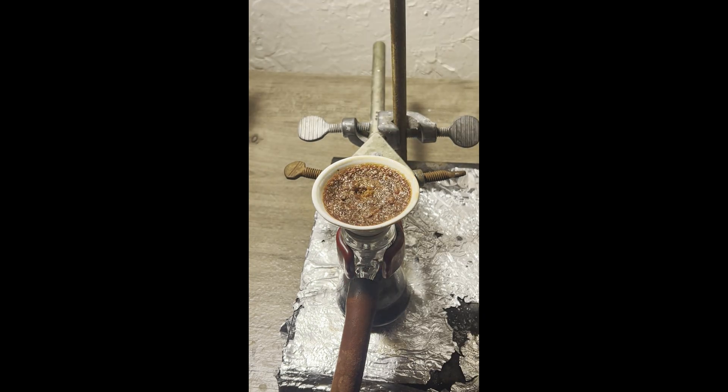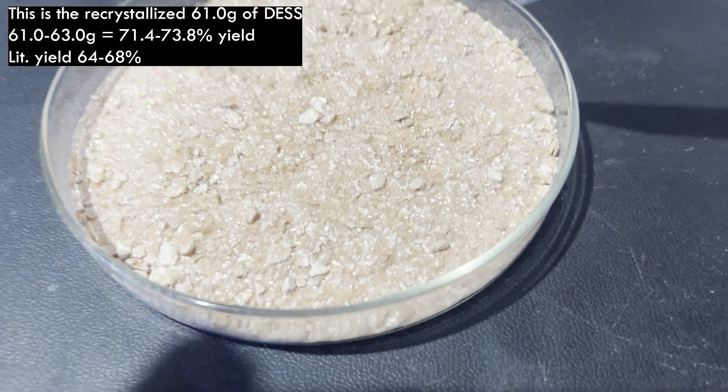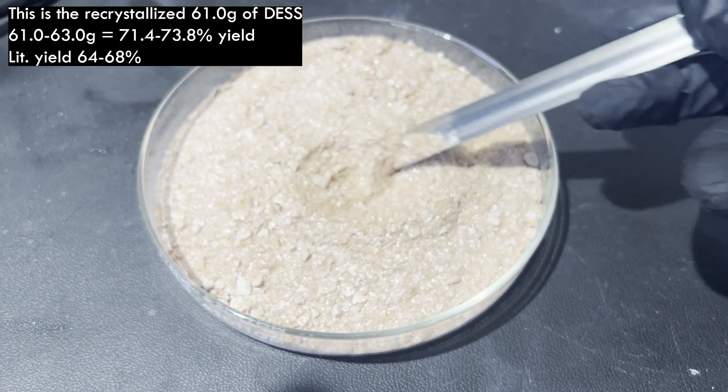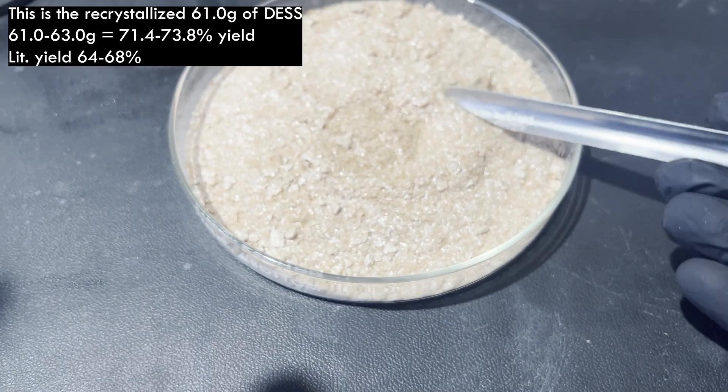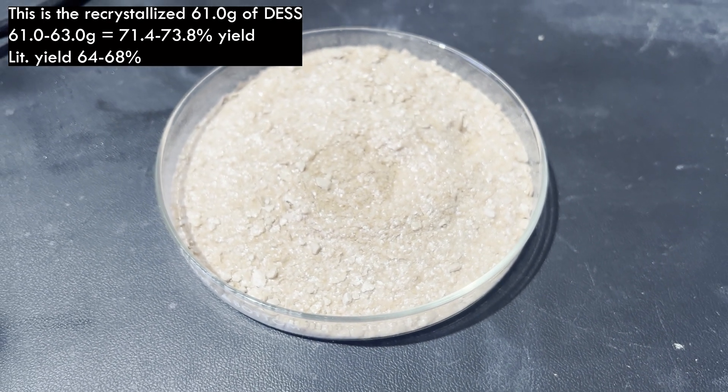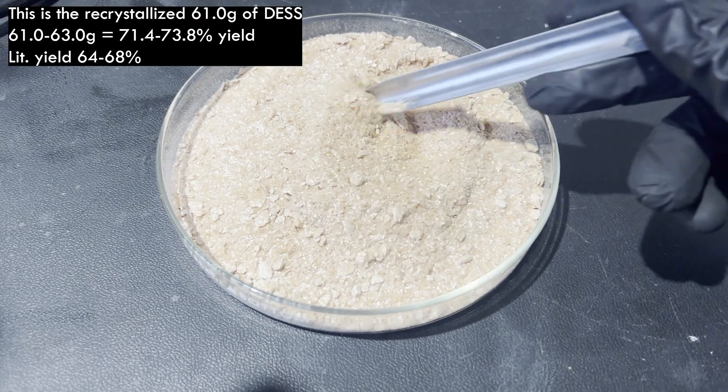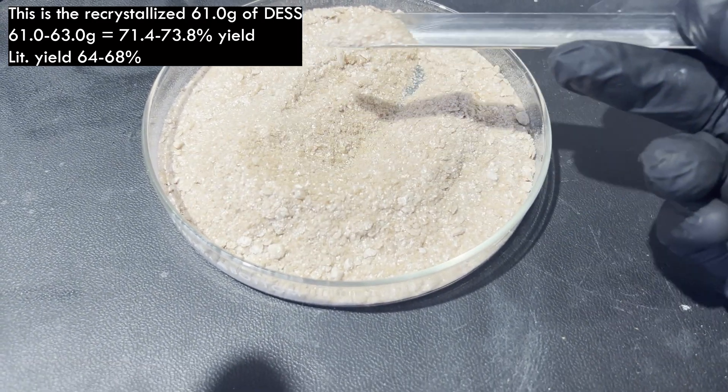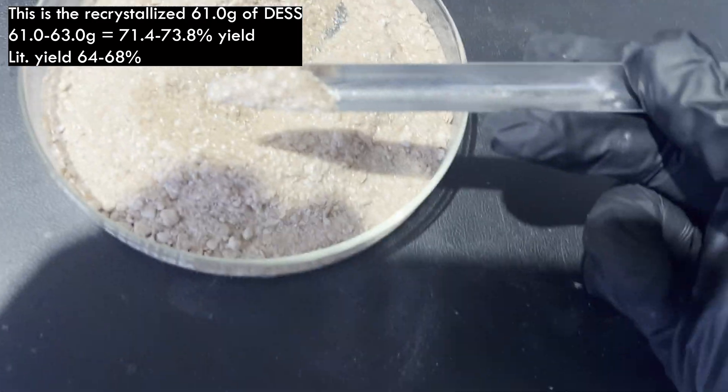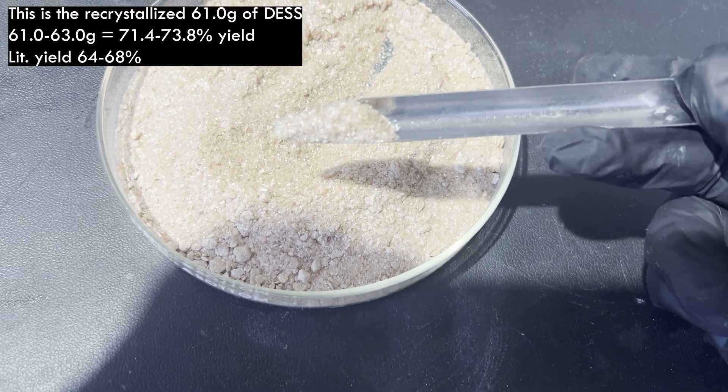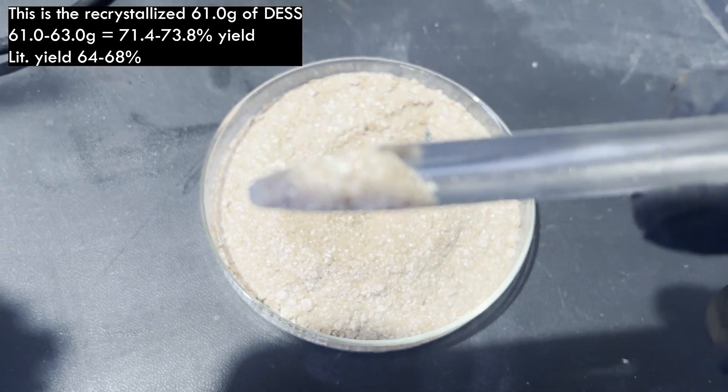In total, I end up with 63 grams of DESS, which is, counting and not counting the 2 grams, 71.4 to 73.8% yield. Higher than that reported in the procedure, which is 64 to 68%. I'm very happy with this yield, even though the end product doesn't have exactly the same characteristics as that described in literature.